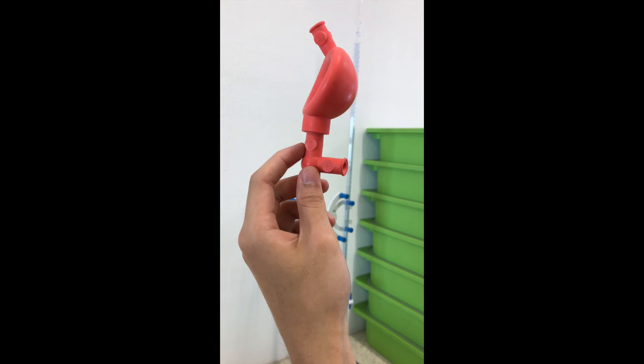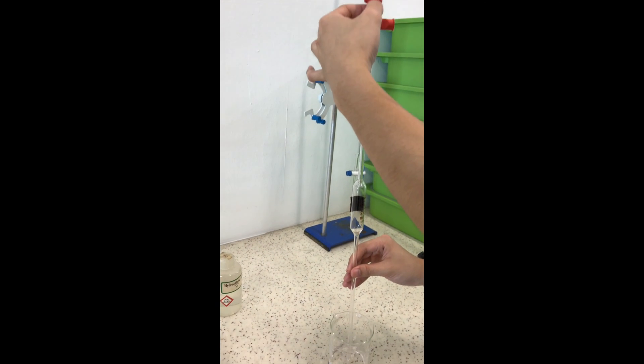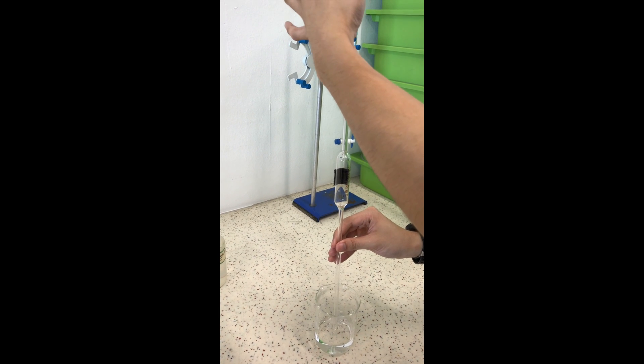Of course, you have to immerse the tip of the pipette into the solution. Holding S, you will start to see that the liquid is being drawn up the pipette.